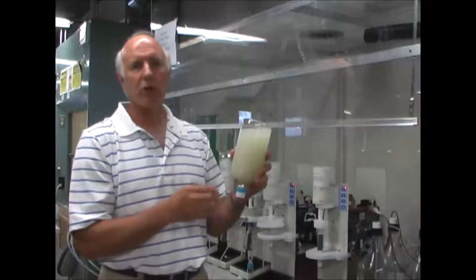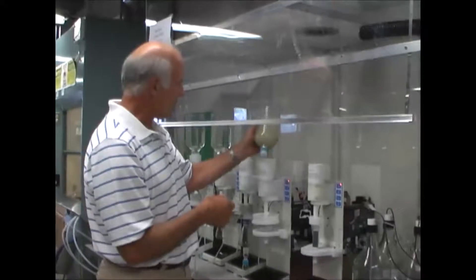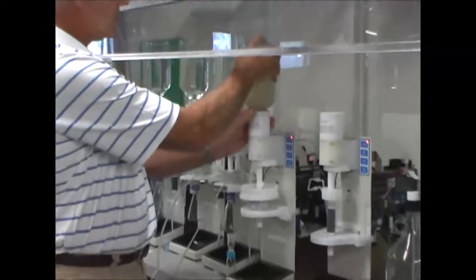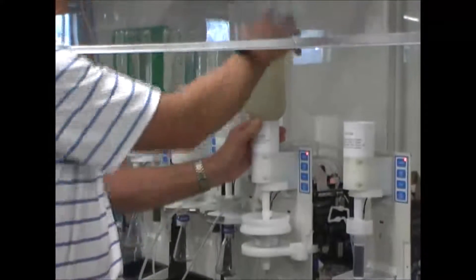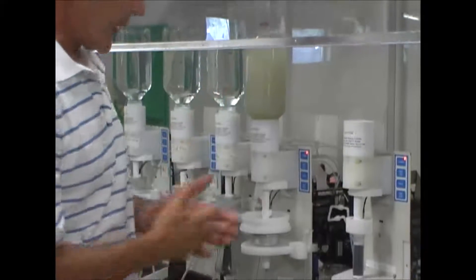Today we're really just going to look at the time it takes to filter this sample. So I come over, load the sample down, press it in place, turn the bottle three quarters of a turn, and now I'm ready.